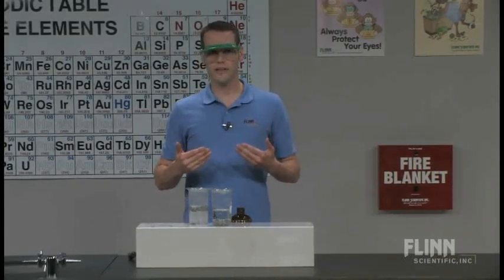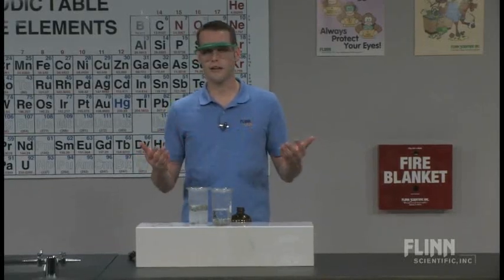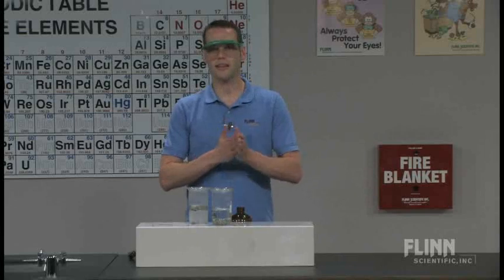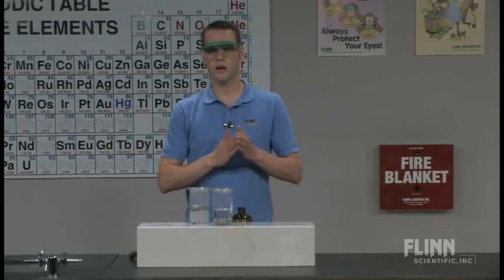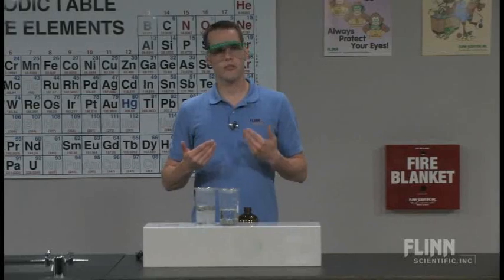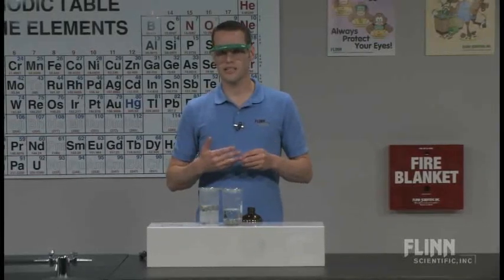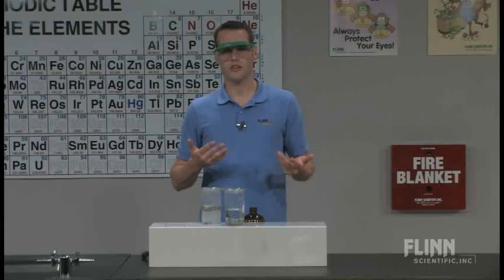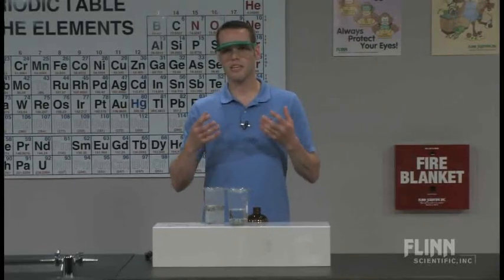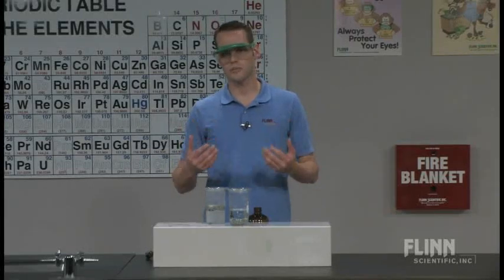Now, if you use the tin chloride that's on your shelf. I inherited a wonderfully well-organized chemical storeroom and I'm certain that some of the chemicals there, looking at the bottles, are older than I am. If you have tin chloride that's been sitting on your shelf for any length of time, it naturally goes to tin oxide, either tin 2 or tin 4. I'm not sure which one. But if you try to make this solution up, you get a milky white precipitate that's almost completely opaque.